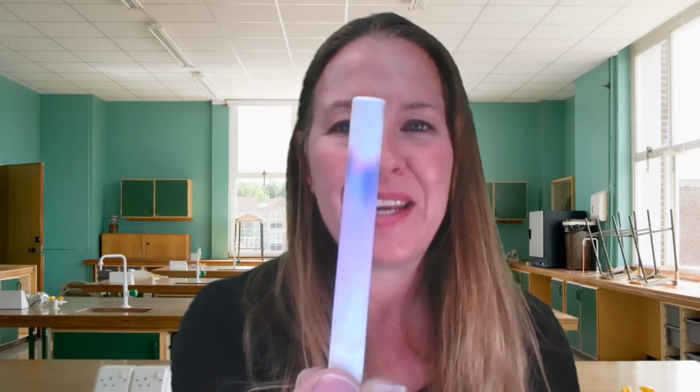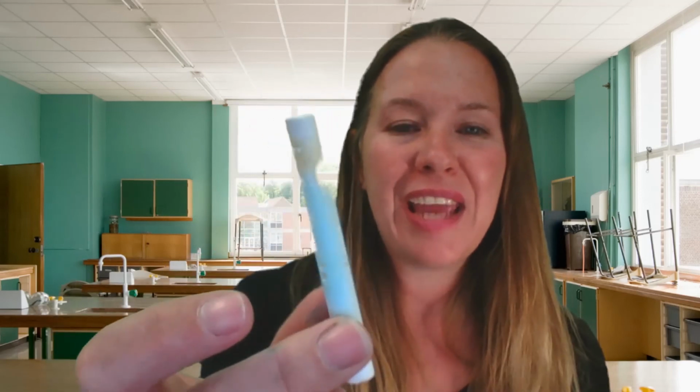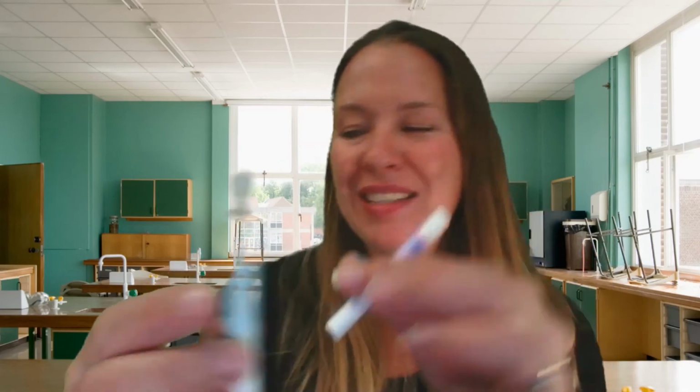It has separated. Okay, so it's neat to go and look at each of them. This is the green. Yeah, it's hard to see, sorry. Yellow and blue make green. And so you can see some blue down here, and you can see some yellow up here. So it's just really neat to see the different pigments that are added together to make a color.